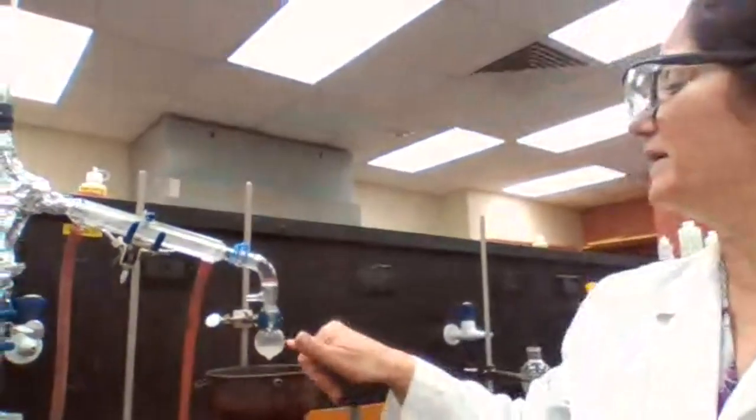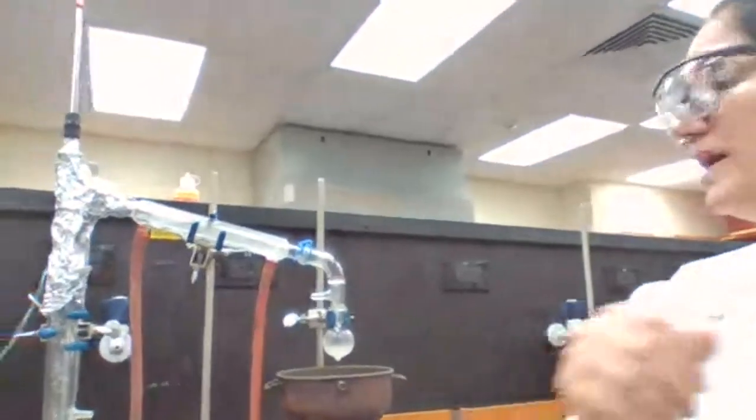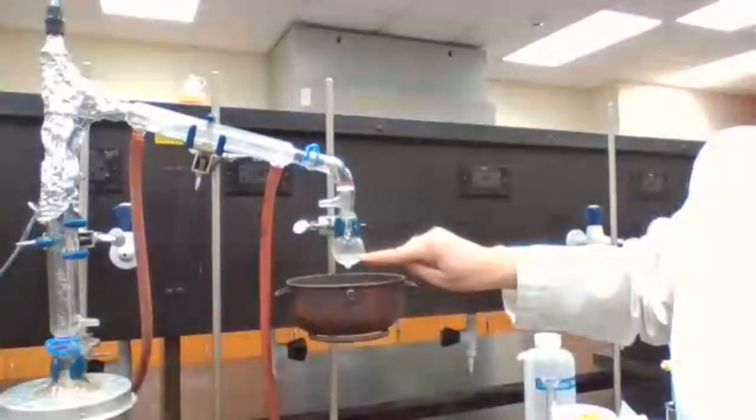It's working. So do I have 8 milliliters here or not? How can I find out I have 8 milliliters? Can I estimate 8 to 10 milliliters here? When should I stop? It's foggy. Okay, I tell you, it's right here. Is it 8 milliliters?